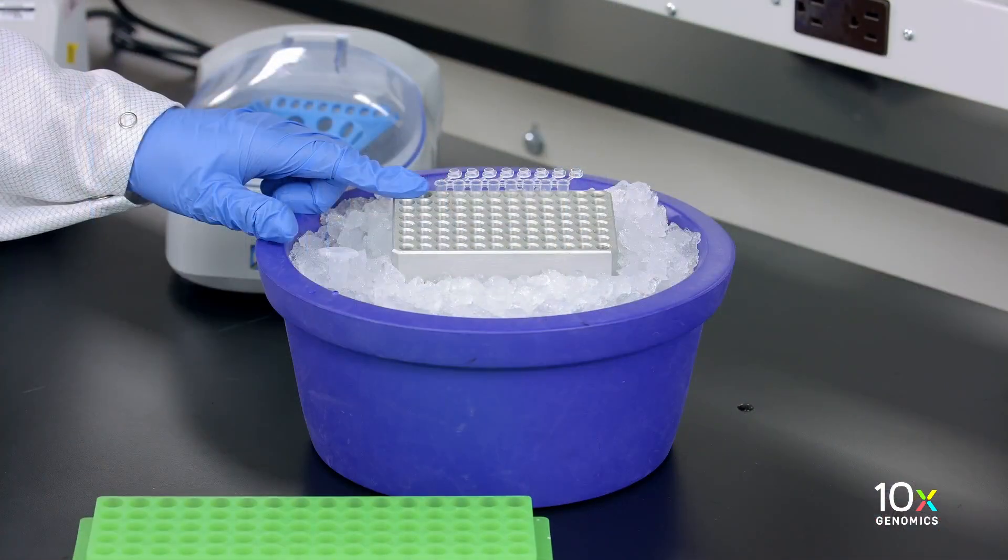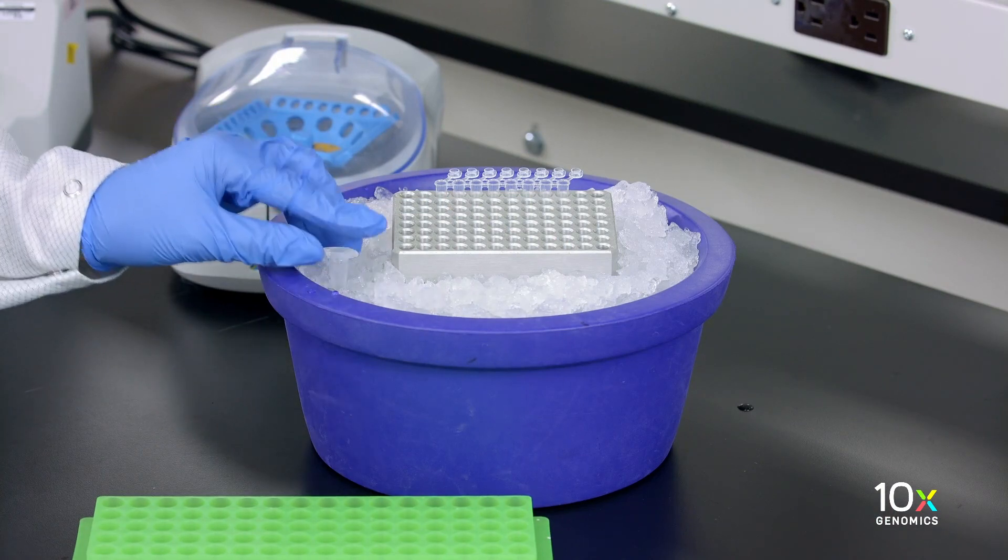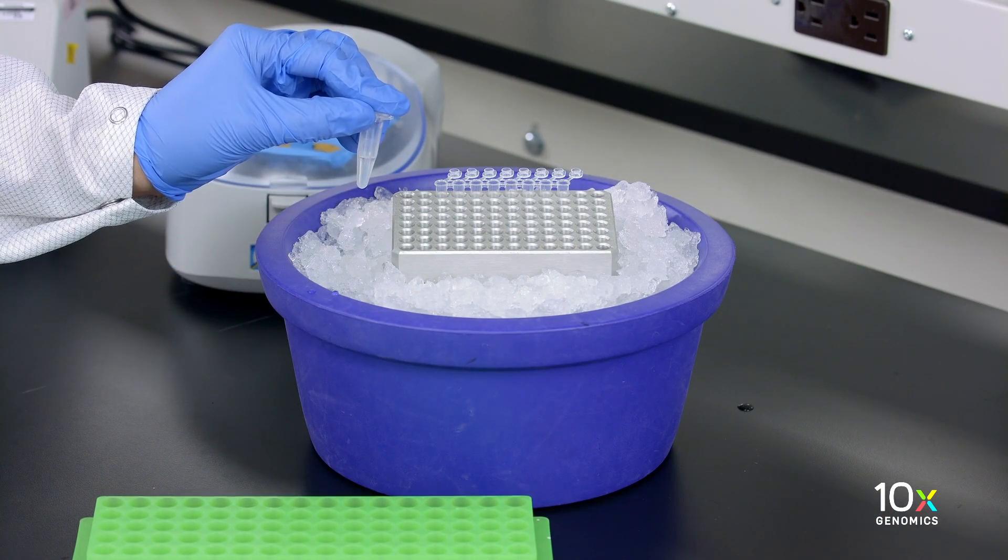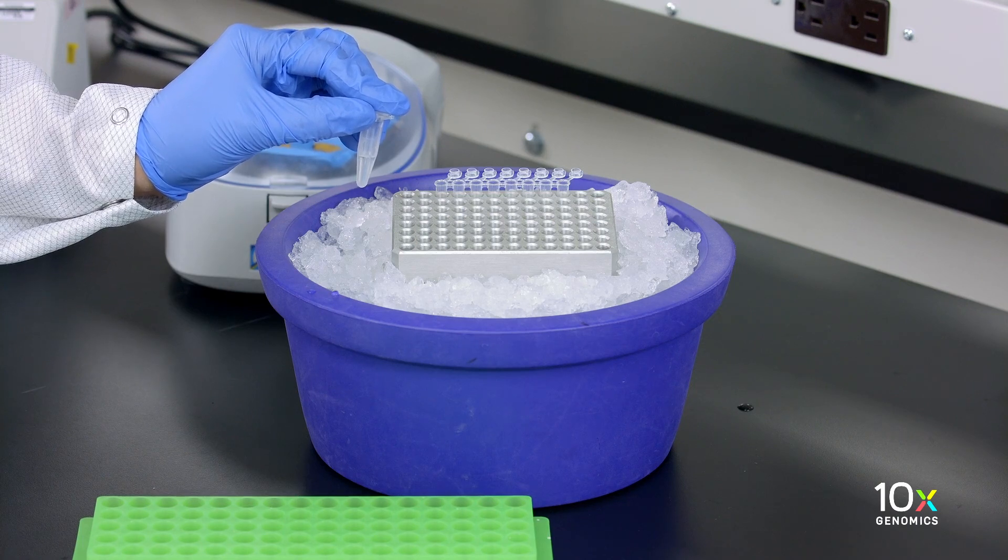We have our master mix aliquotted into a PCR strip tube and our single cell suspension sitting on ice. Now we are ready to combine our master mix with water and our single cell suspension.